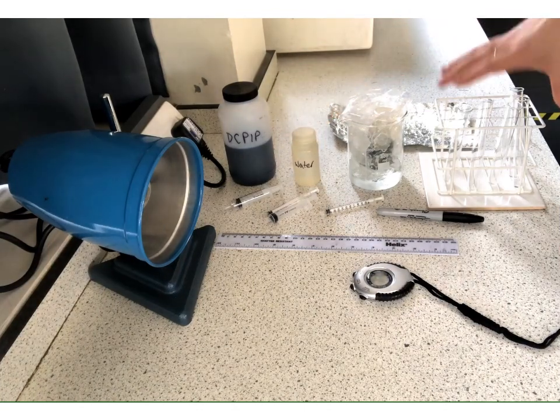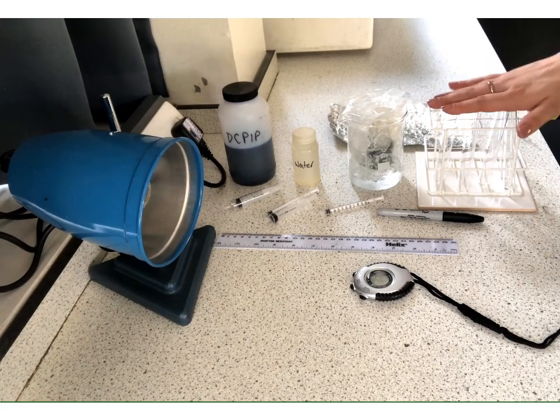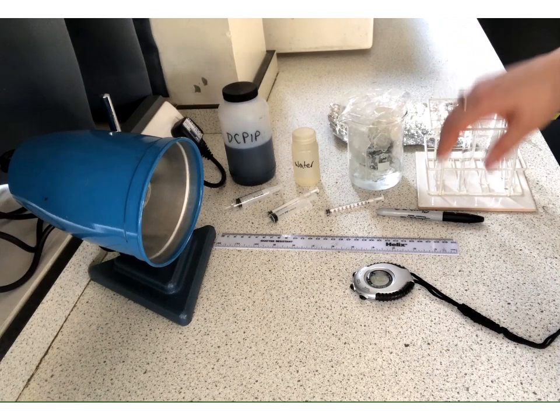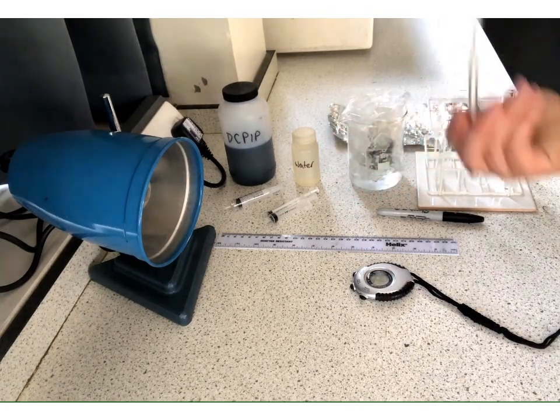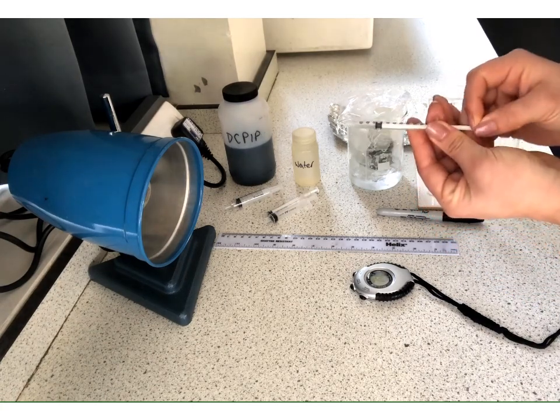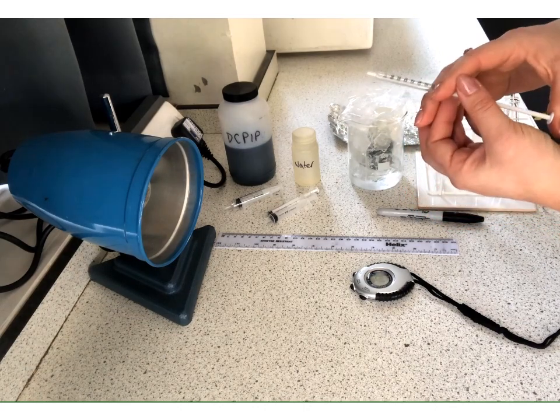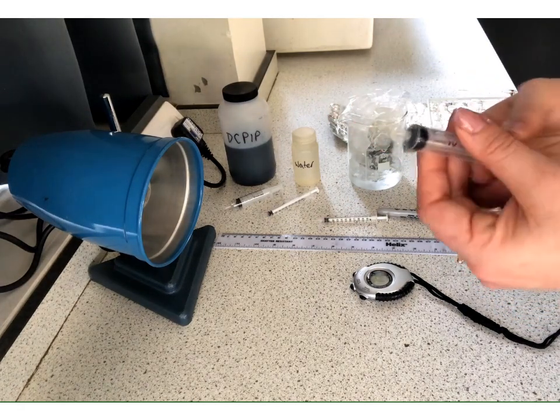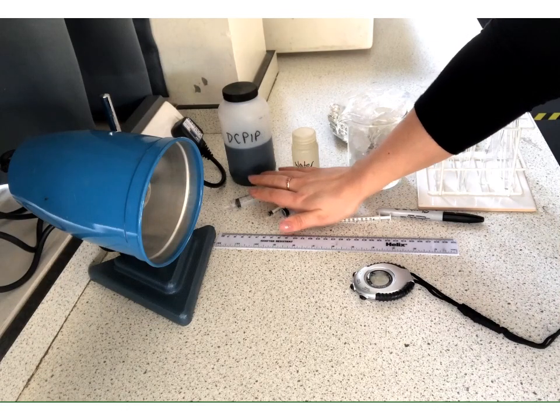Okay, we've got a selection of test tubes that we're going to use for our different runs of the experiment, and obviously we've got them in a rack. We've also got a selection of different syringes. Now consider as well, when we're going through this, why we have got these different sizes. So for example, this syringe goes up to 1 centimetre cubed only. That's the maximum volume that it can measure out, whereas these larger ones are able to go up to 5 centimetres cubed. Okay, so we have a selection of those there.